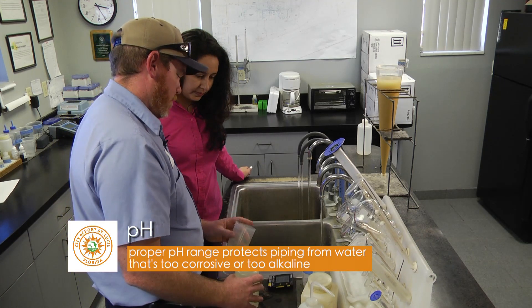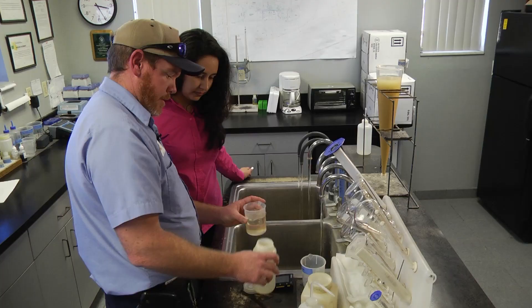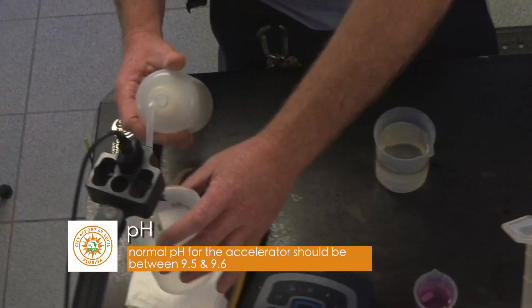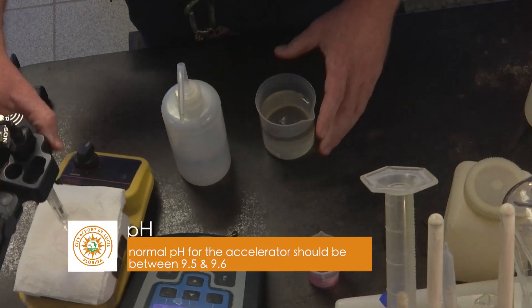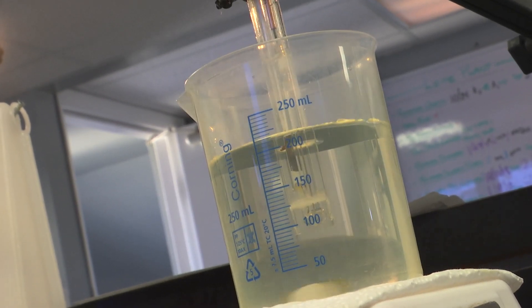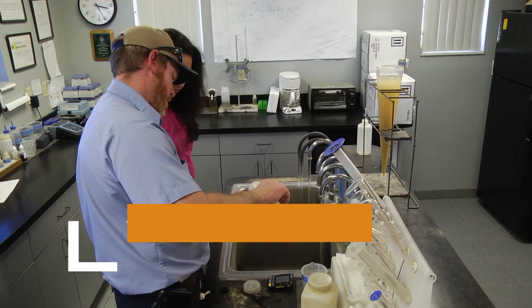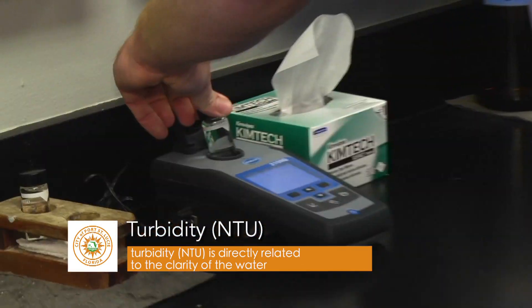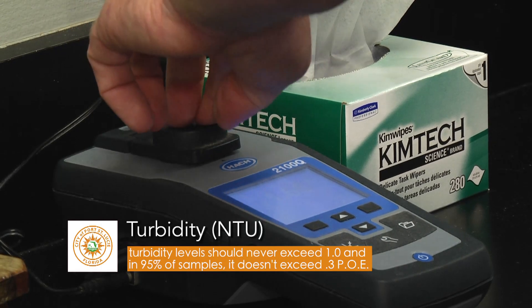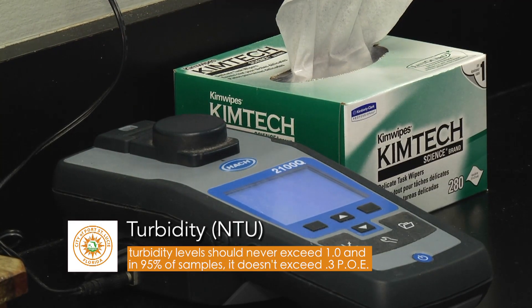So we'll take this and we'll make sure that's empty. Give us a little bit of this to get started on our pH. We rinse our pH probe off with DI water before we put our sample in there. There's a magnet in here and there's a magnet mixer inside. We're going to grab this NTU cell. Make sure we get a representative sample. We'll put this in here with this white arrow pointing towards this arrow here, close the lid, and then push the read button.